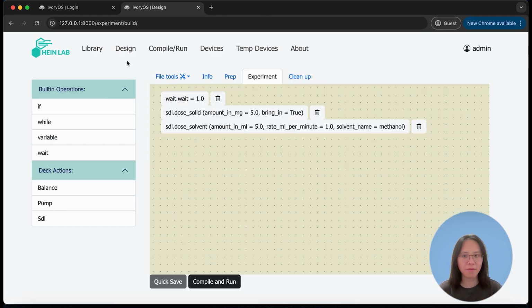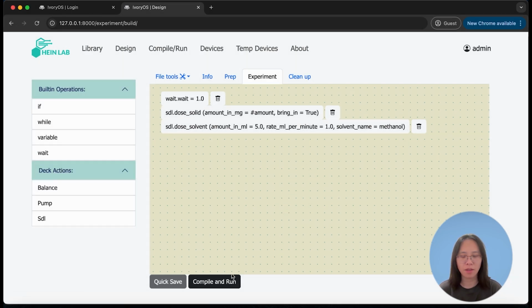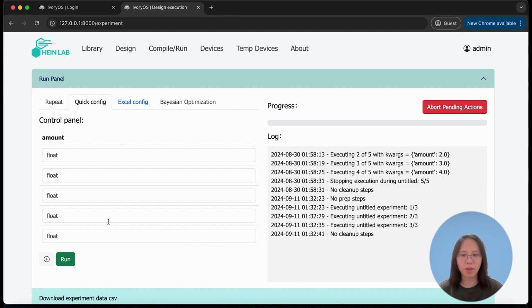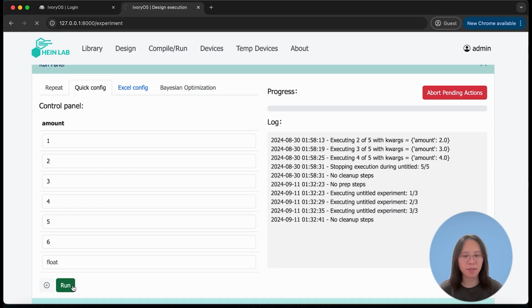In my last design, I only have fixed parameters, meaning I can only repeat the same workflow over and over again. But for more flexible iterations, I would have to define which parameter I want to configure in the later iteration steps. So for example, in the dose solid step, instead of dosing 5 all the time, I would just use the pound notation and name this variable as amount. And I will save the change to the workflow and compile it. There are 5 entries where you can input different parameters for different iterations. Now I will just input some random numbers, and you can also add more entries if you need more iterations. So now I will run these 6 experiments.